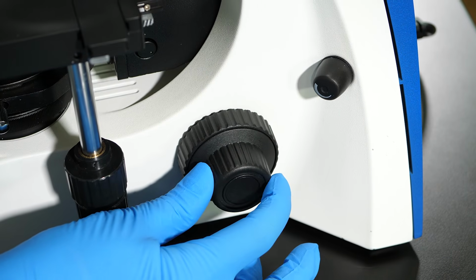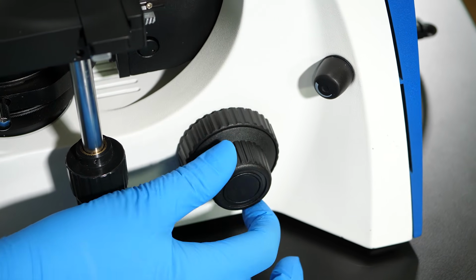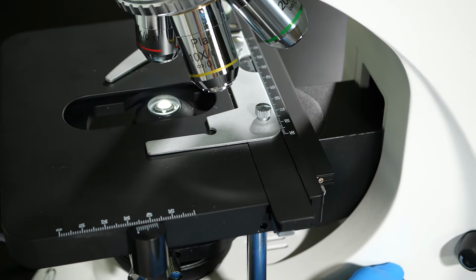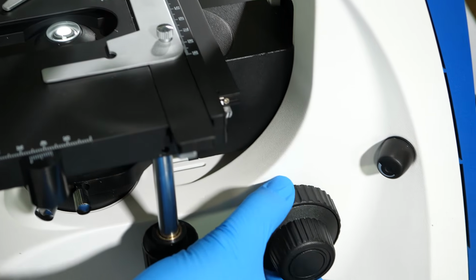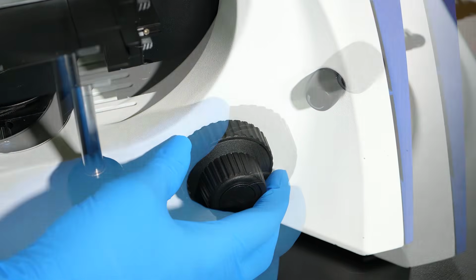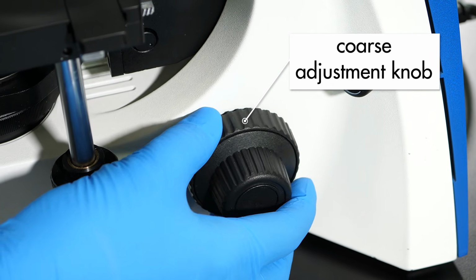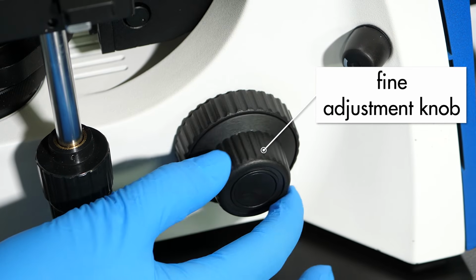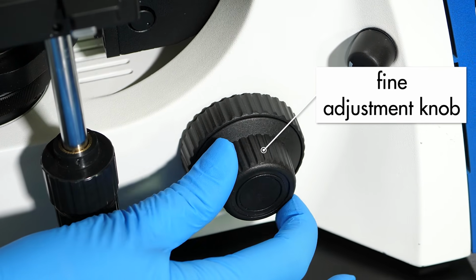Just behind the stage are the focus adjustment knobs. These knobs move the stage up or down to bring the image into focus. In some models of microscopes, the adjustment knobs raise or lower the nosepiece and head instead of the stage. The larger knob is the coarse adjustment knob, used for approximate focusing. The smaller knob is the fine adjustment knob, used for sharp focusing.